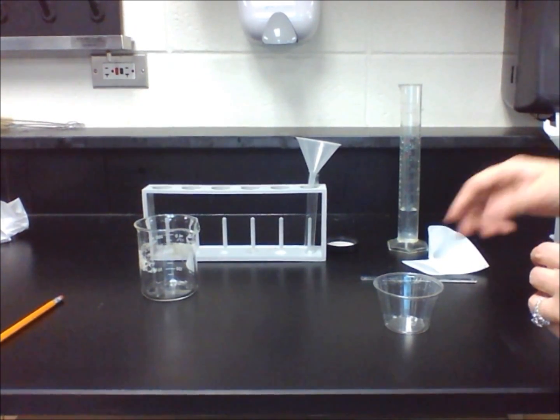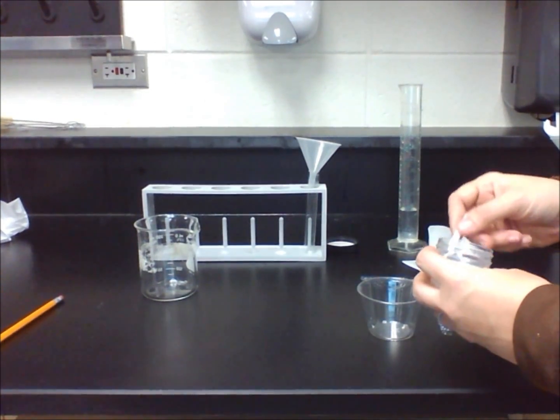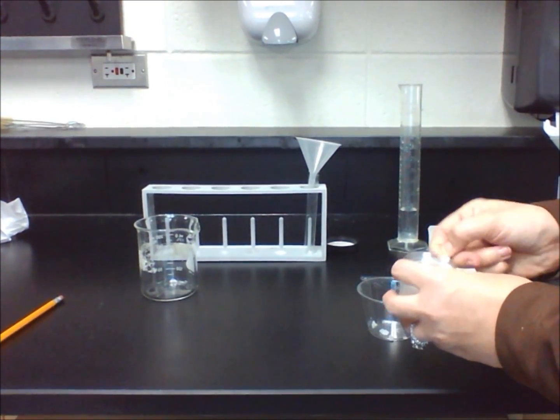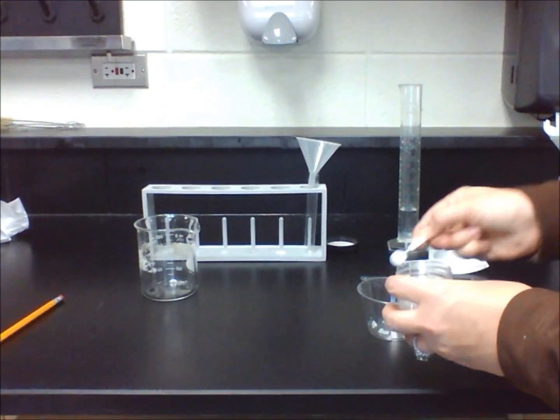In lab 15.2 we are going to clean rock salt. Pour four lab scoops of rock salt into a cup and examine what you see.